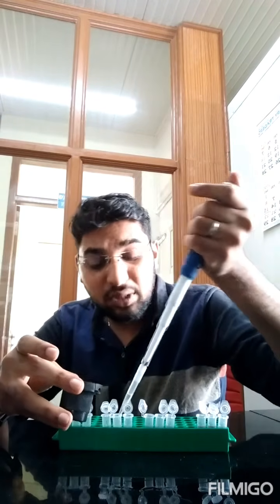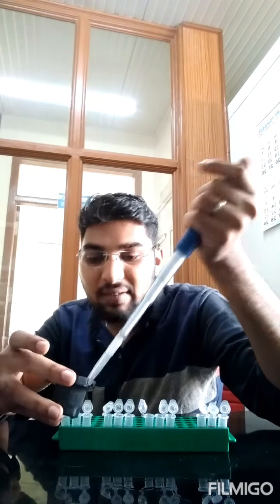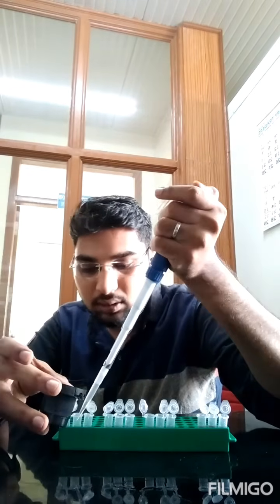We are adding mainly toluene to remove the colorful layer. So there are only 2 layers you will get after adding this toluene. Only the one layer which has that reddish color will have proline. To make the absorbance easier, we are adding this organic solvent.